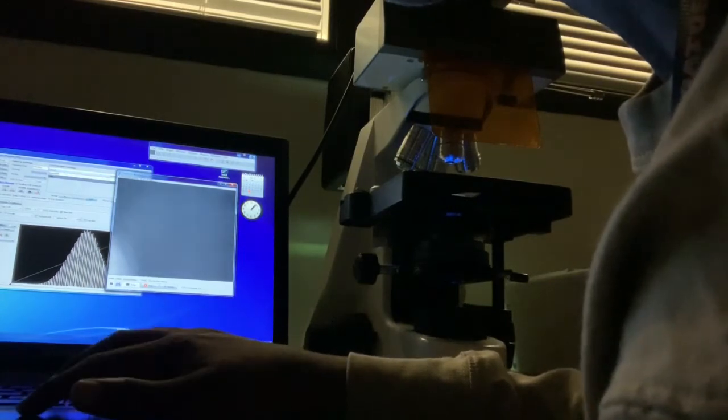So it's probably going to be pretty small, so I'll adjust the exposure to make it a little bit higher. Maybe not. Let's see. Maybe keep the gain at 0. So you see it's a little too bright. So maybe lower this back down to 25. Maybe go a little lower.